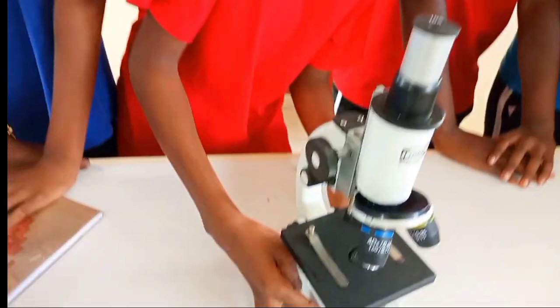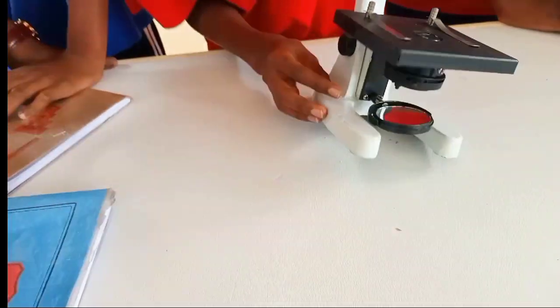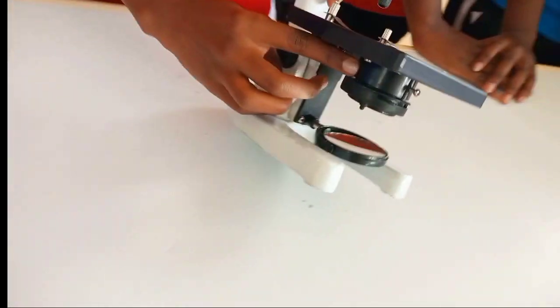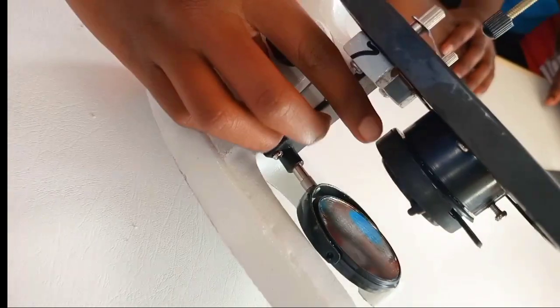And don't forget the mirror. The upper part here is called the condenser, and this is the diaphragm.